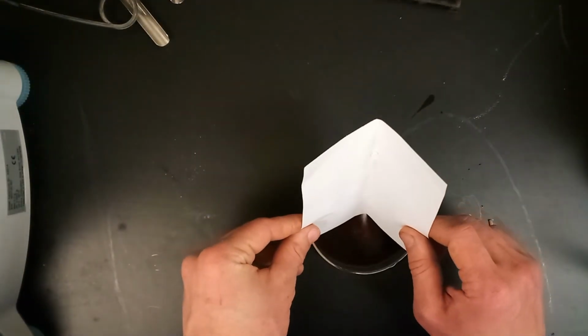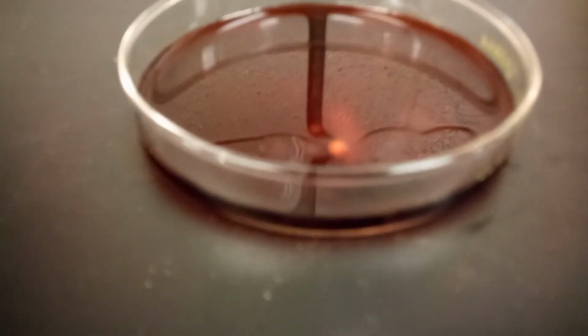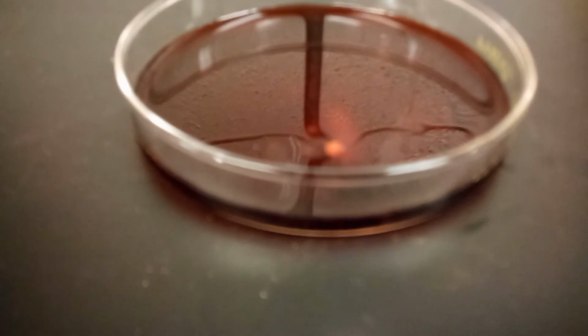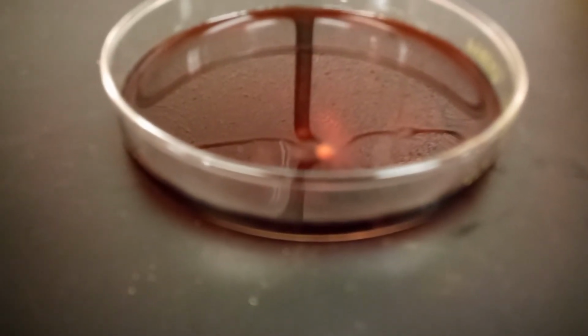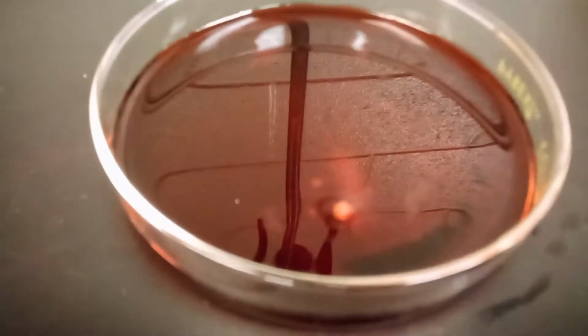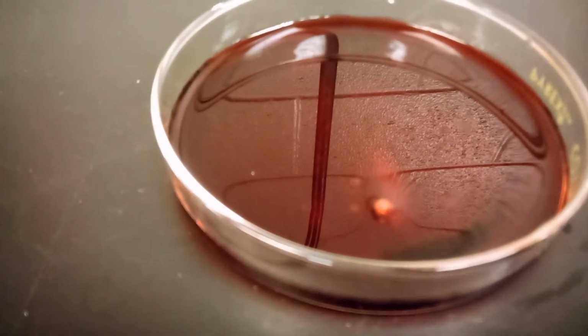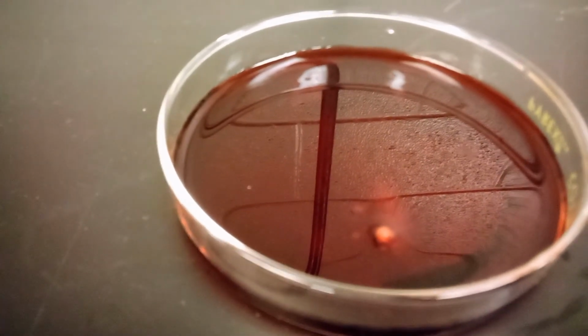So into the dish it goes, and a closer view for you to see if any color changes happen during this one, which is about a minute, the lab says. So just let it go for a minute. Again, I zoomed this up, so it's not a complete minute for you if you're watching this.